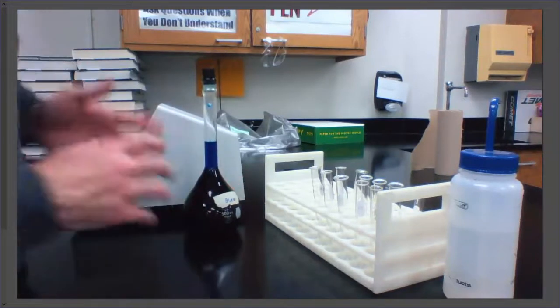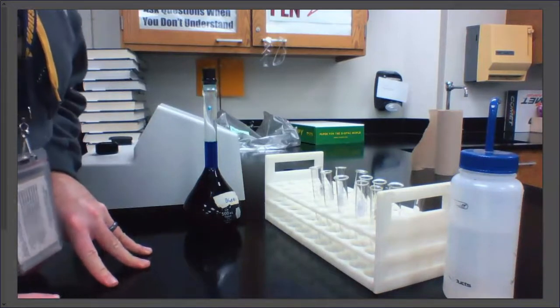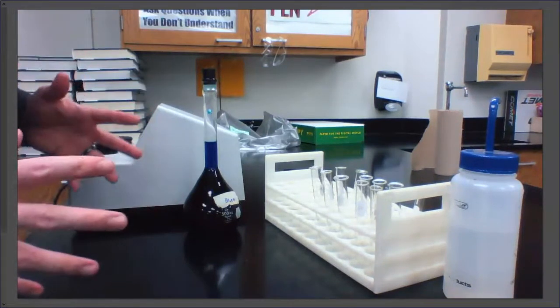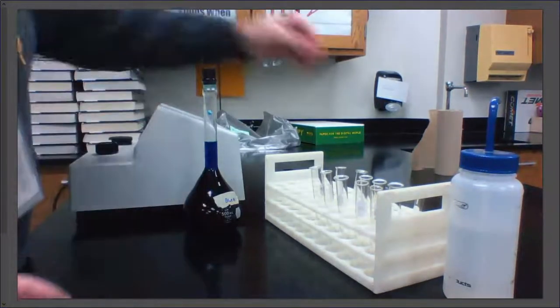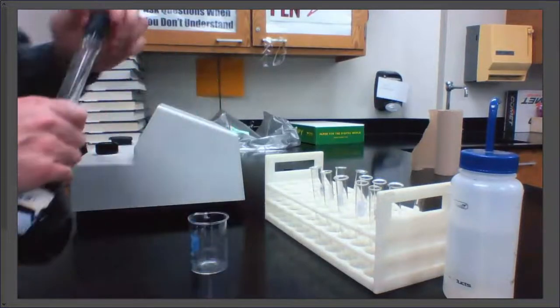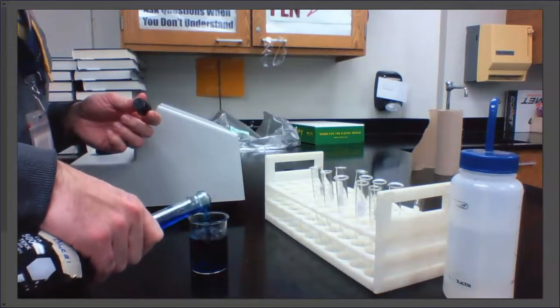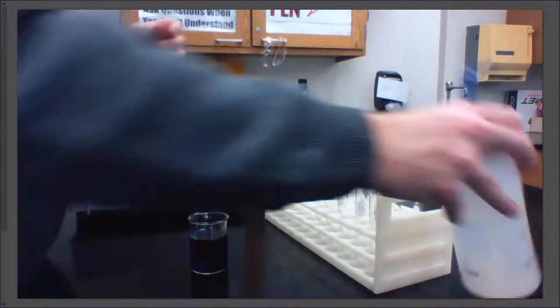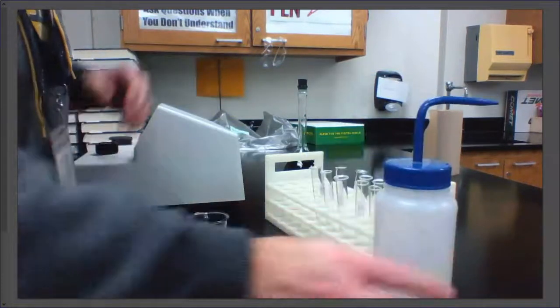So I've got my blue dye. The molarity of that is 7.2 times 10 to the negative 6th. It's on the worksheet that goes along with this. I have posted a worksheet in the plans with this video, and that worksheet has a data table on it, and we're going to fill that out in the near future. But what we need to do is set up these varying molarities. So I just have a beaker. I'm going to take some of my blue dye and fill it up. We'll use about that much. That should be plenty. And I also need distilled water. This is just a wash bottle, and there's plenty of distilled water in there for me to use.